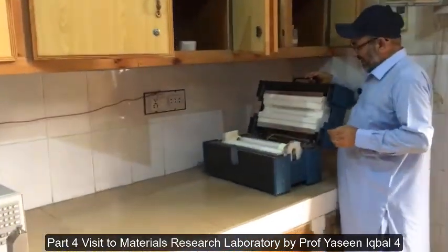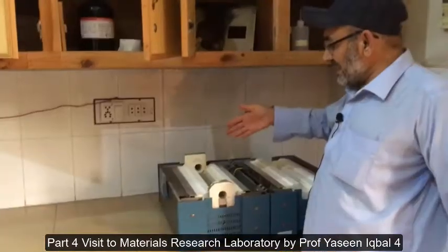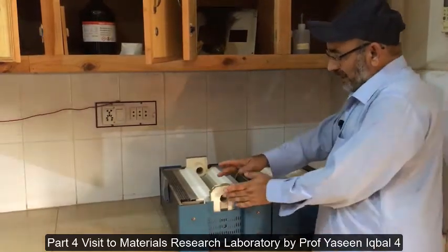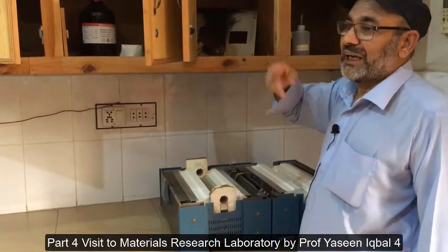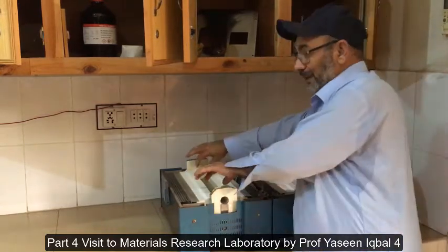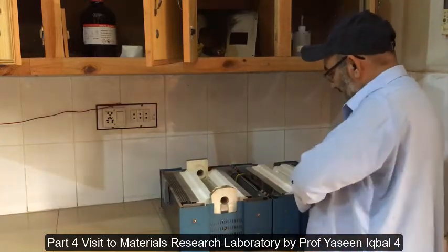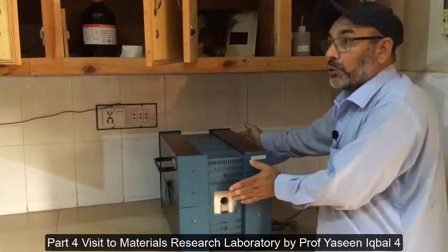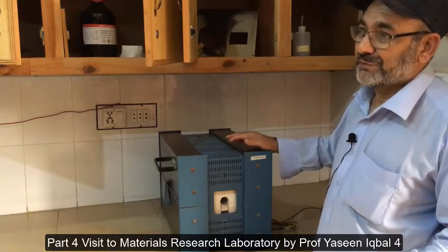Let us look inside a tube furnace — how the tube furnace looks from inside. These are the ends and we put a tube of alumina, Al2O3, or mullite, which is aluminum silicate. A tube goes here and we put a sample with some holder in the middle of the tube. When it is covered like this we can close it, and we call it an open air environment.